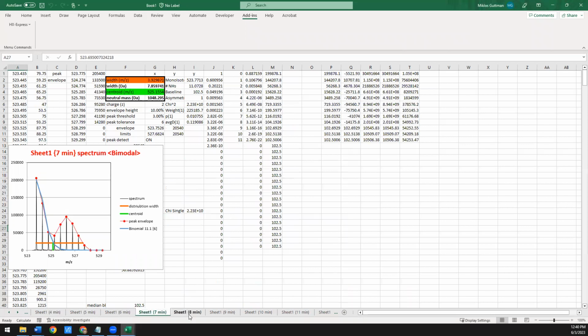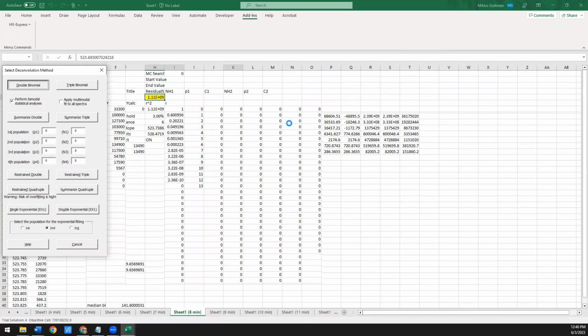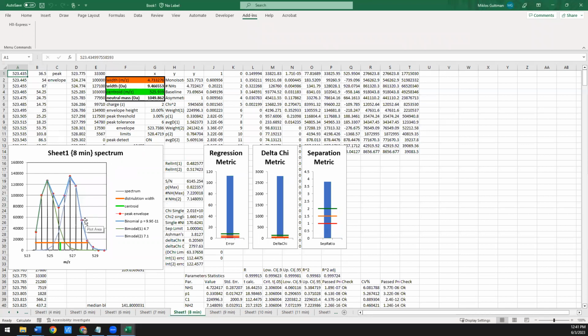And then if we look at an intermediate case, let's say this one, we're going to do the exact same thing with statistical analysis. We're going to do the double binomial. Okay, so it popped up the result. And again, these two populations are well enough resolved that you still have really good confidence in these values for the relative intensities as well as their deuteration states.